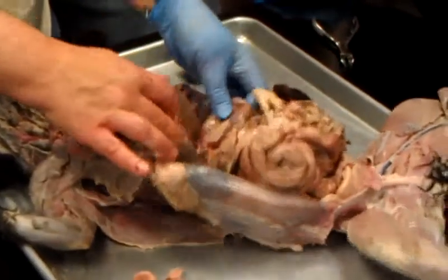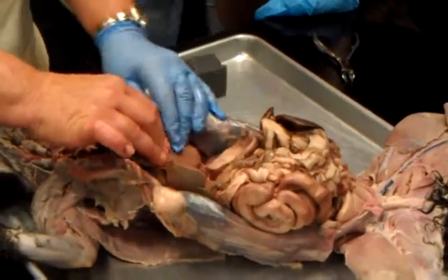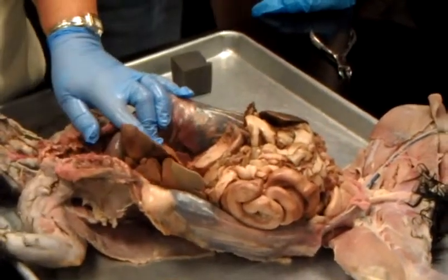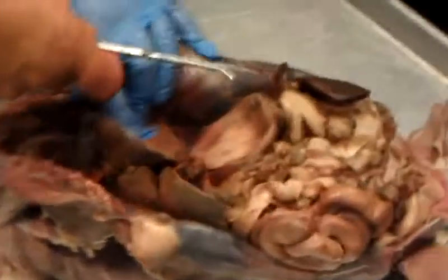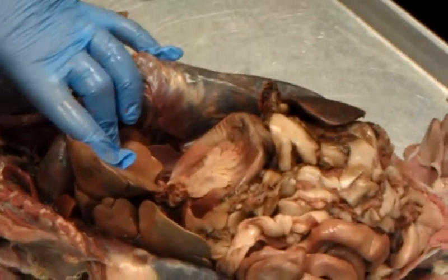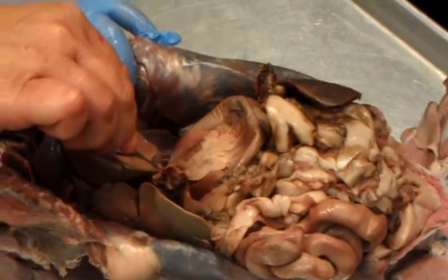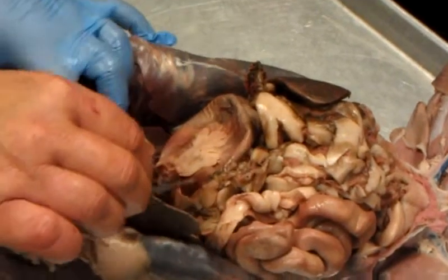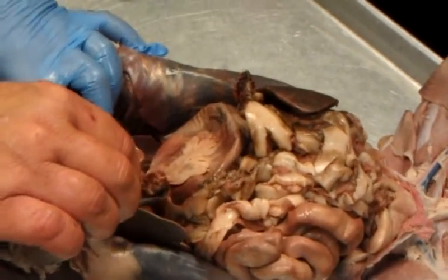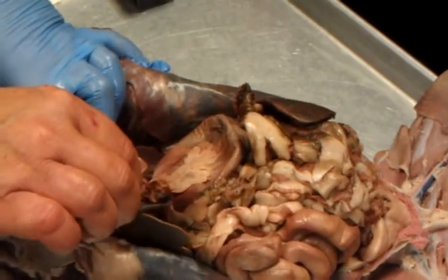Okay, then I come underneath. I have here. You got to be willing to handle it. This is the what? Stomach. Cardiac part of the stomach is up here because the esophagus is running all the way behind. I know we saw it up here, we're not going to dig it out. It's going behind. This is the cardiac part. This is the fundus. This is the body. This is the pylorus. So cardiac, fundus, body, pylorus.